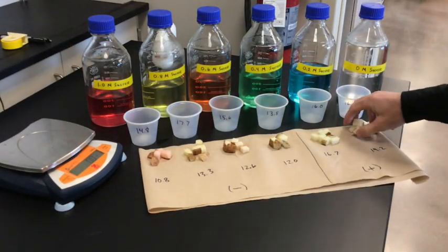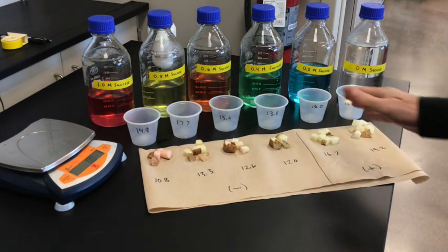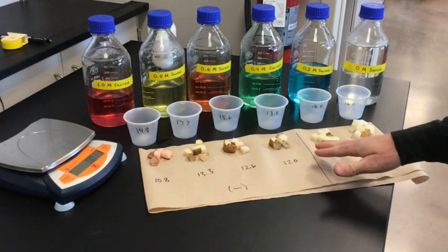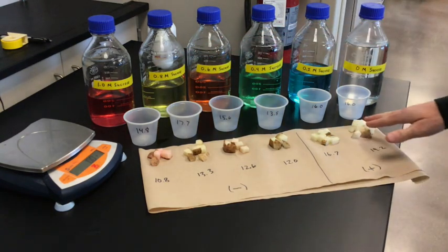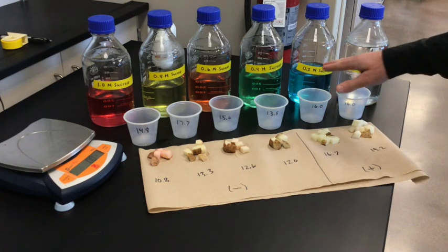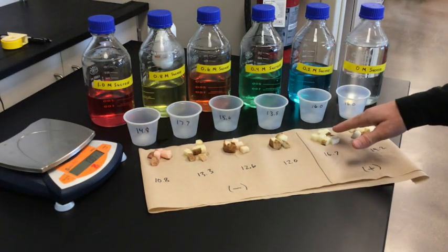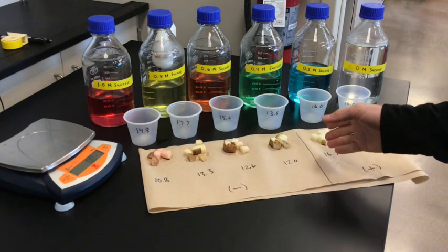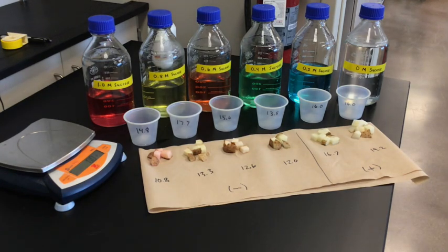To answer our original question — what's the molarity of a potato cell — we know that the potato chunks in sucrose solutions from 0.4 to 0.6 to 0.8 to 1.0 all lost mass, so they were in hypertonic solutions. The chunks in 0.2 molar and 0 molar gained mass, so they were in hypotonic solutions. Somewhere between these two ranges there's an isotonic solution equal to the molarity of a potato cell — let's graph that to find out what it actually is.